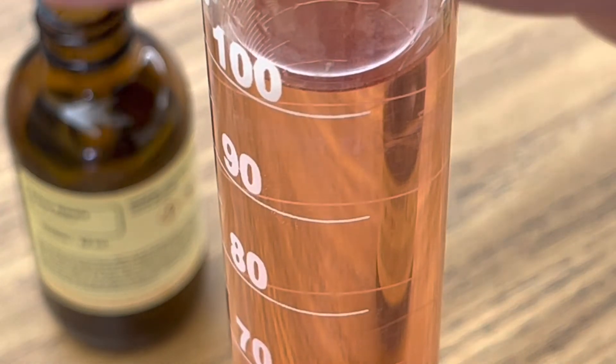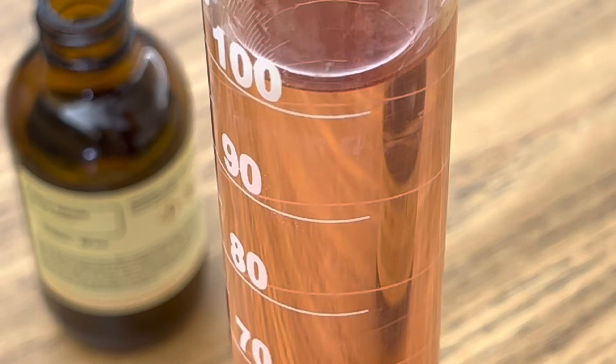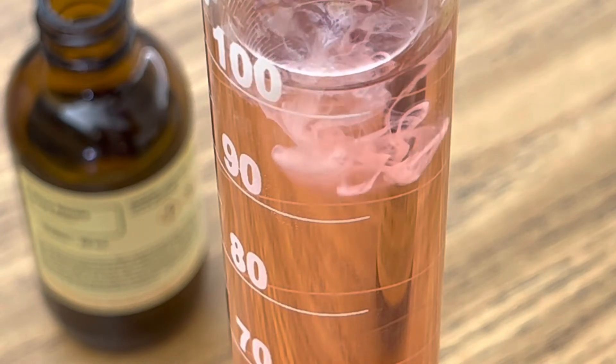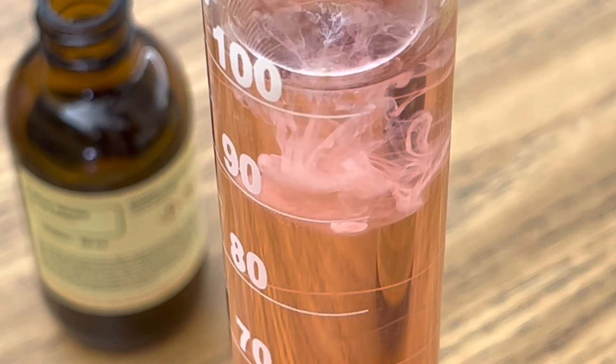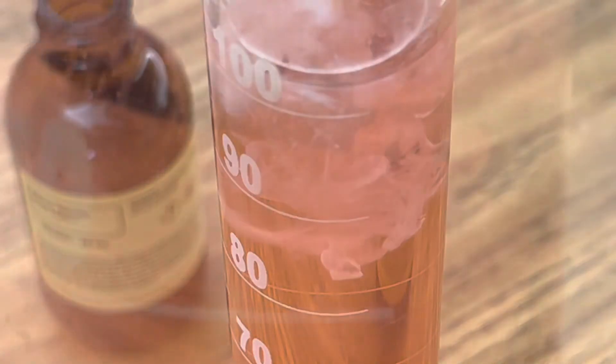There's a few drops of silver nitrate — watch for that precipitation. Just look at those beautiful silver chloride crystals precipitating out of the solution.